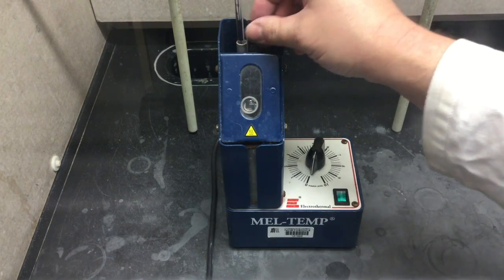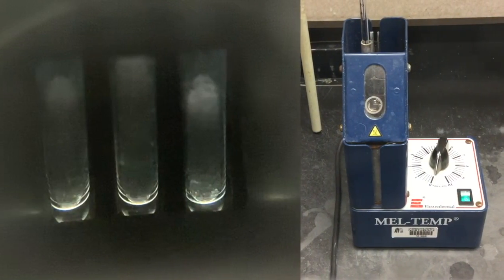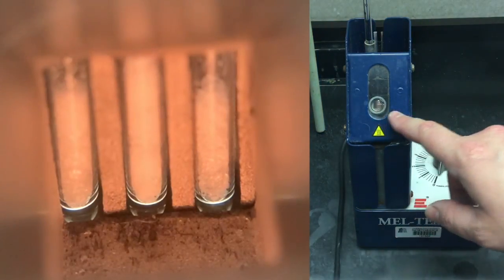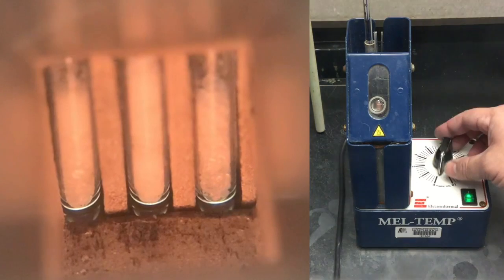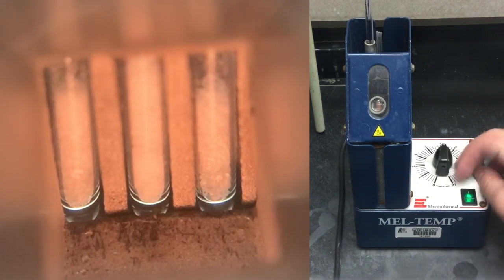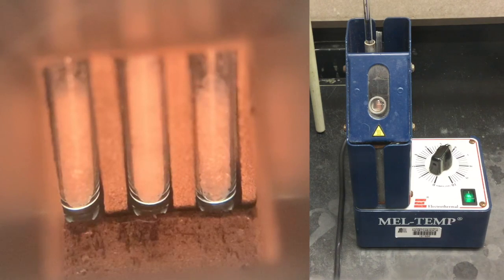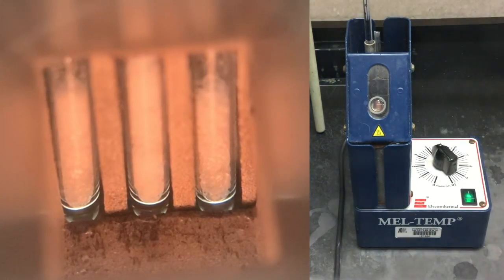Now we're going to start this off. Turn that on — you can see the light there. We're going to start this off at six, and then once we reach about a hundred, we're going to turn that down to four.